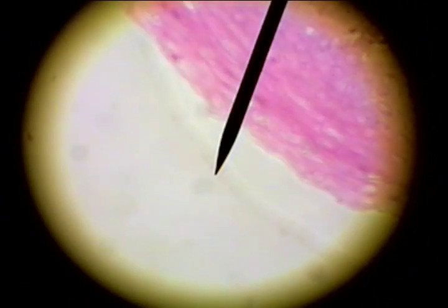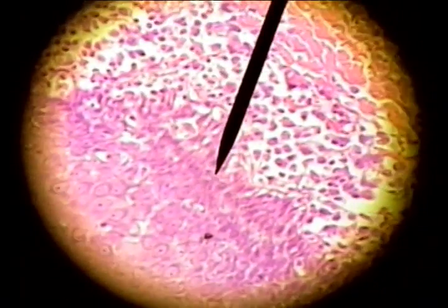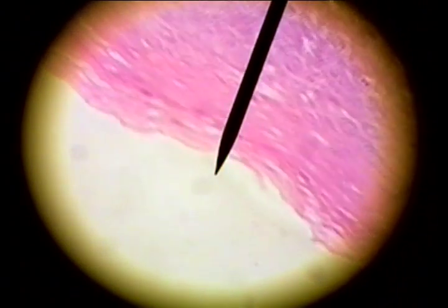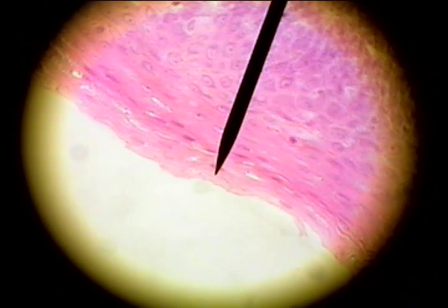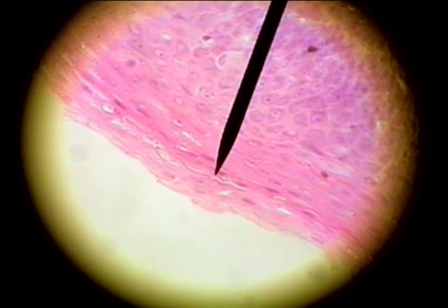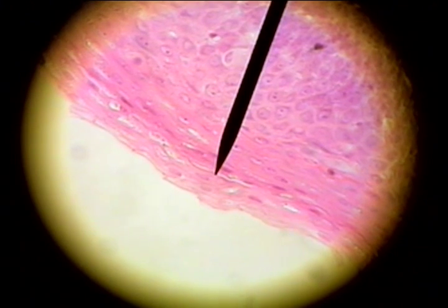Here's the basement membrane here. The cells are stacked, and as they reach the surface, the nuclei become flat and compressed. So this is stratified squamous epithelium found on the palatine tonsil.